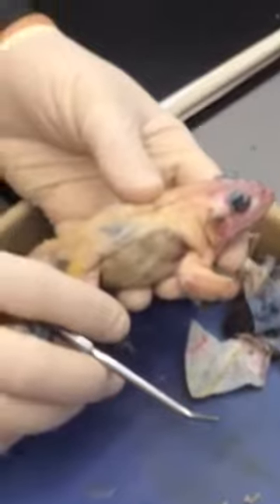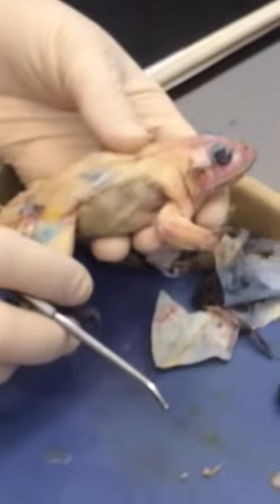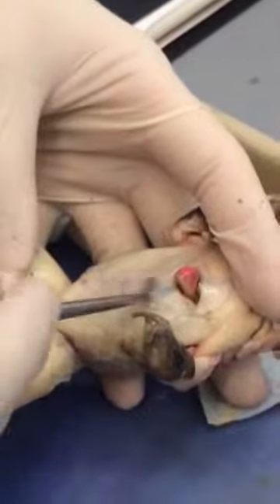Now there are multiple layers to all these — these are the most external ones, I'm not having you dissect any further. There's a cutaway here that shows internal abdominal oblique, because the next layer down has more muscle. You also need to know rectus abdominis, right here.